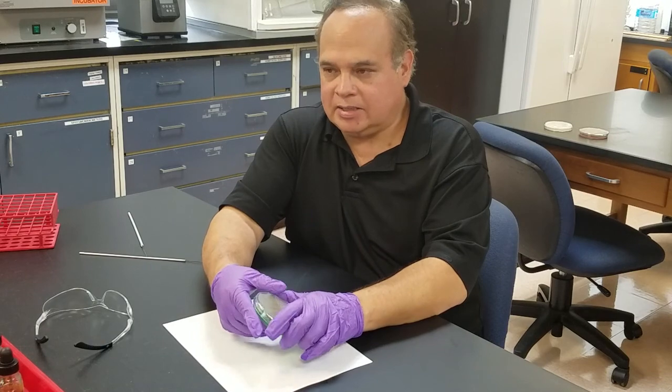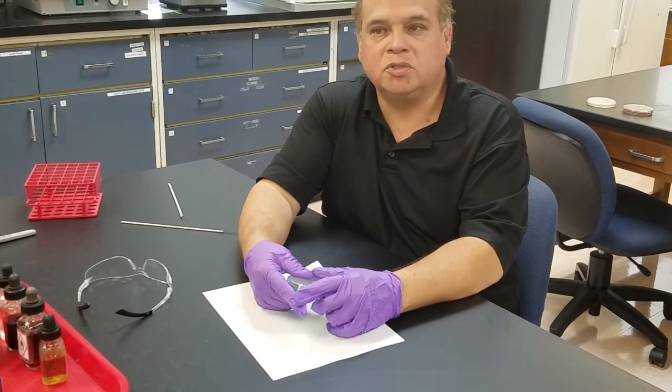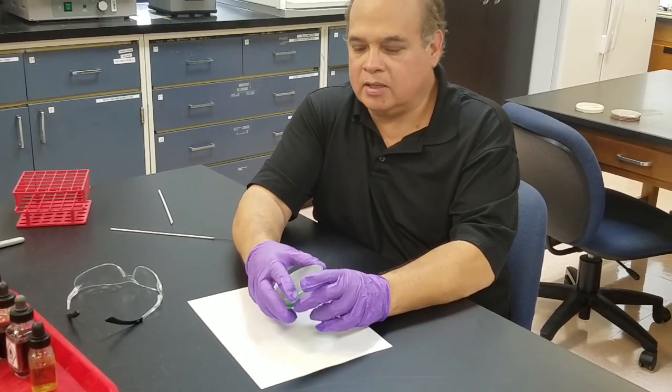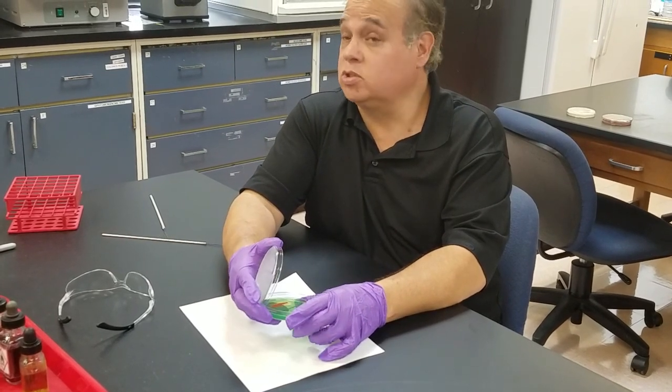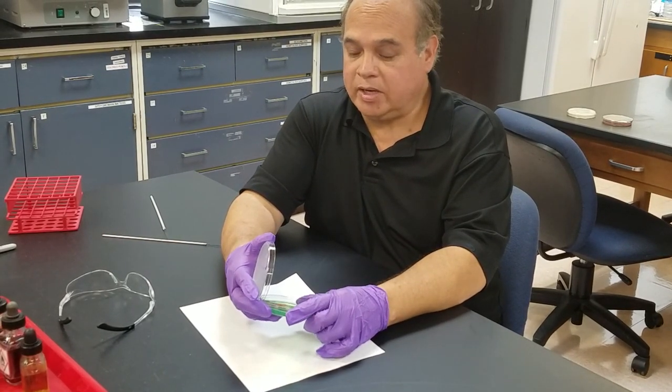We've already inoculated this plate with Serratia marcescens, which is positive, and another organism that is unknown to me at this moment, but it's negative.